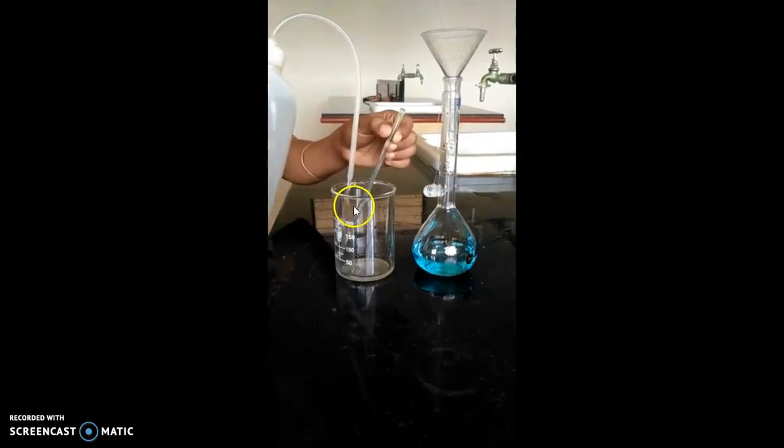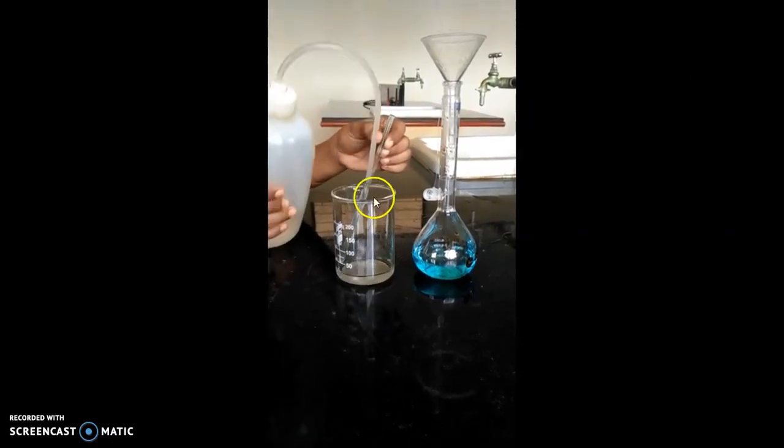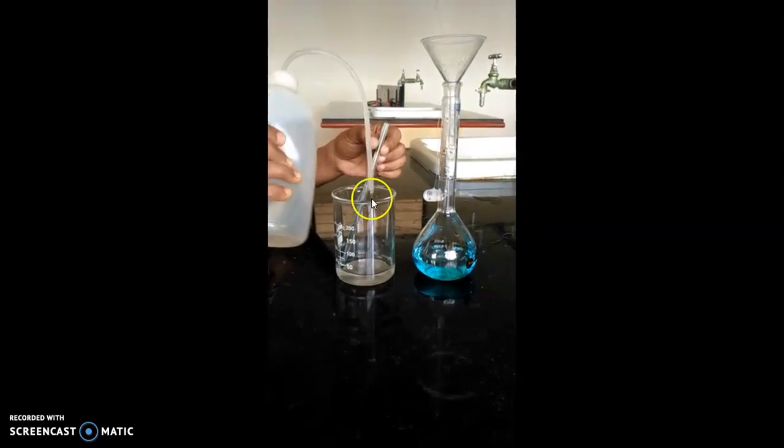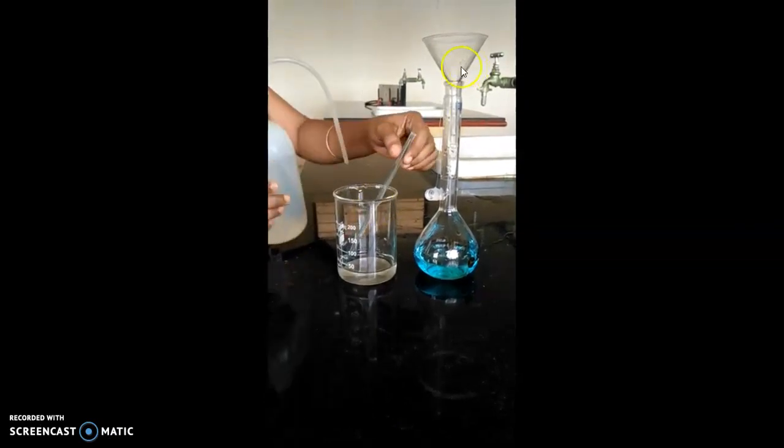Later, the beaker has to be rinsed properly using distilled water, and those contents also have to be taken into the standard flask.